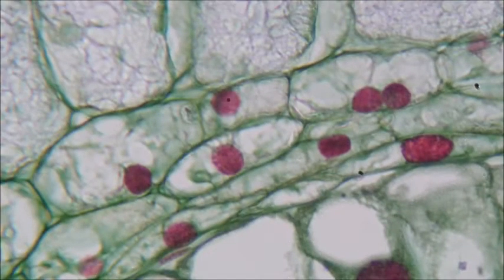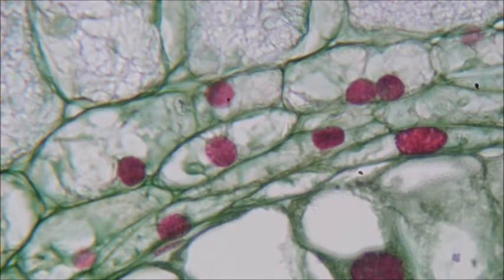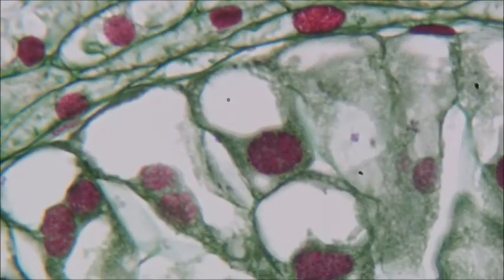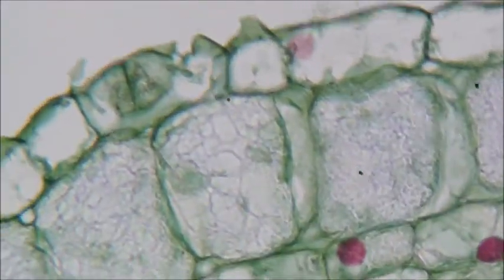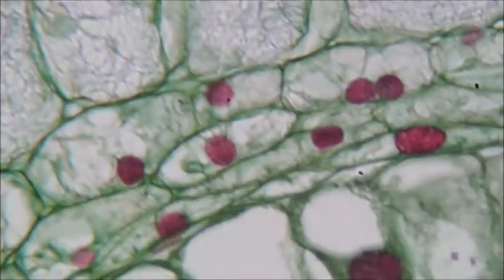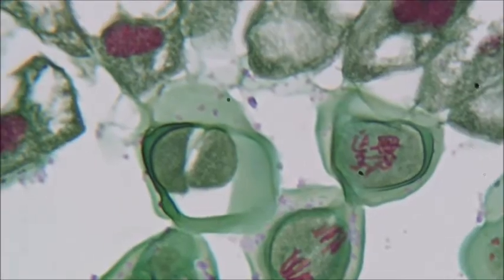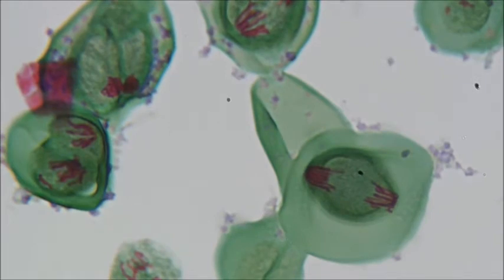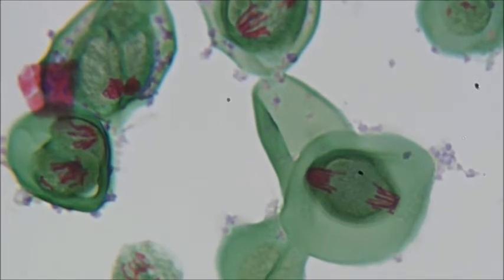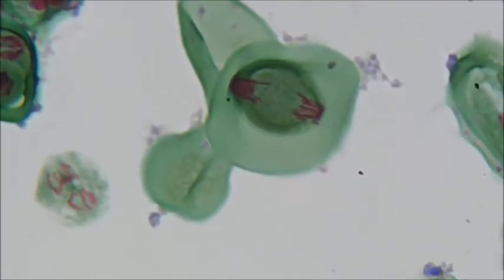All right, I'm just going to take you for a little bit of a tour through this plant cross section, so you can clearly see some cells all bunched together there. This is a cross section from a stem. This is on the outside of the stem, and then it's been sliced, and we're looking down the stem, and this is the middle of the stem where the cells are reproducing, and that is actually pretty outrageously awesome. That is mitosis happening right there.